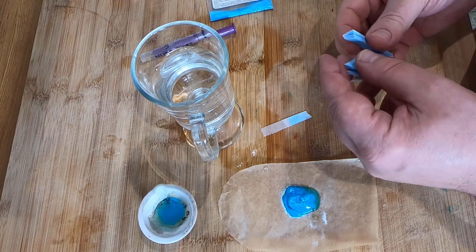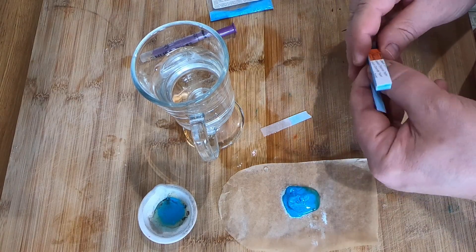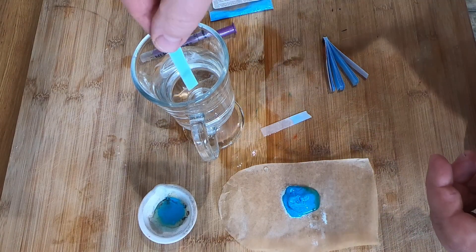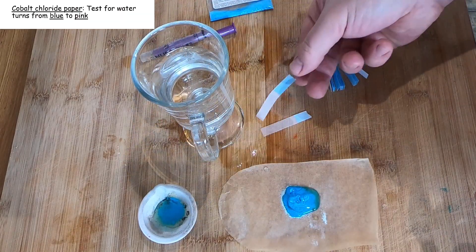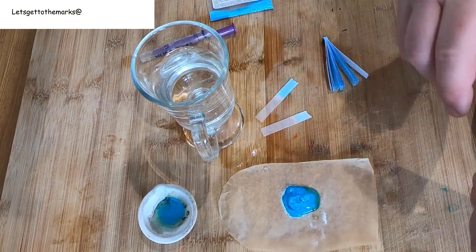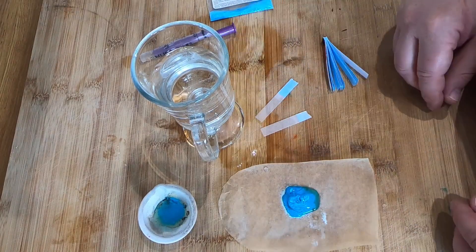It looks a bit white there, but you can see it's going more and more pink as I leave it. I'll do that again. This is blue to pink. I know it's whitish pink, but really you just need to say blue to pink. And those are your two tests for water.